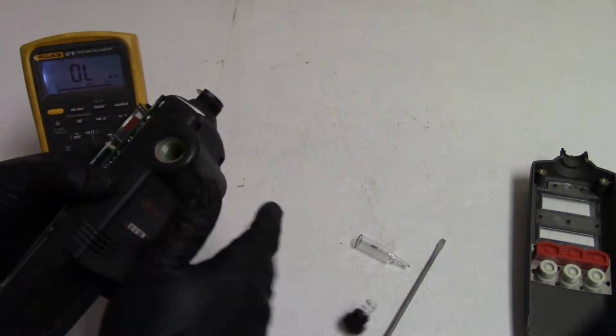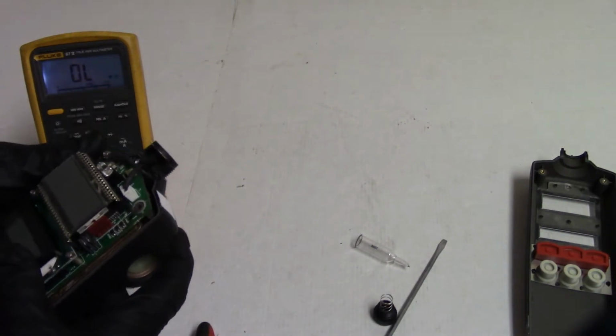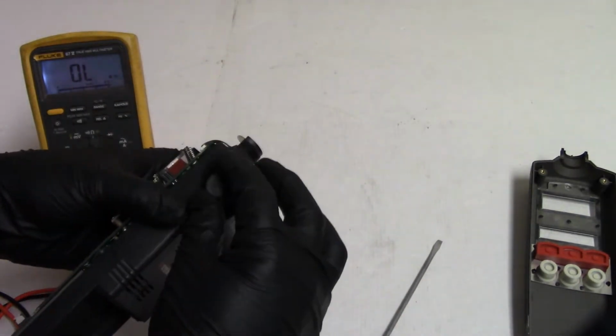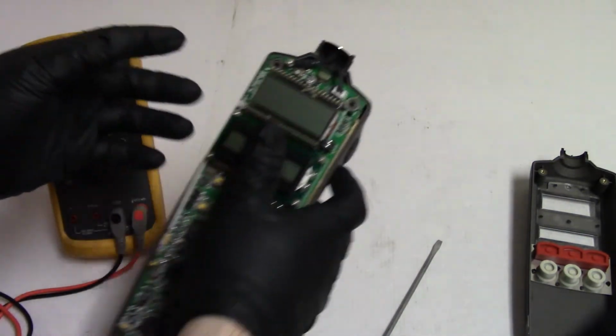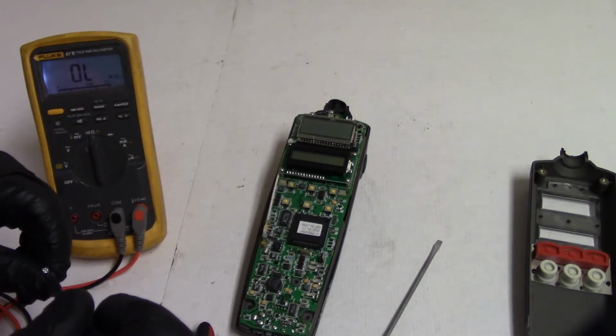Come on. There we go. Had to get it down all the way. Alright, that's good. Now I'm going to put that screw down in the bottom.